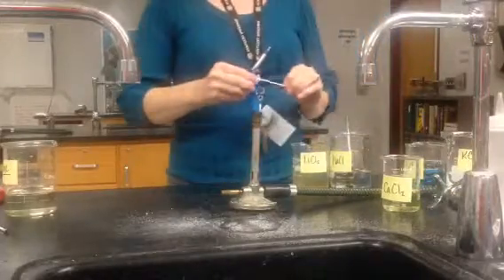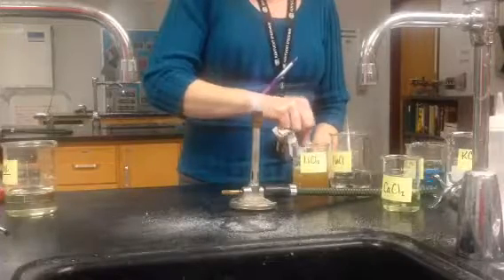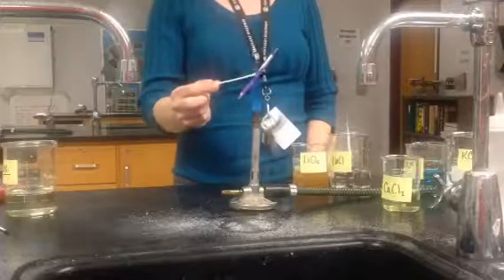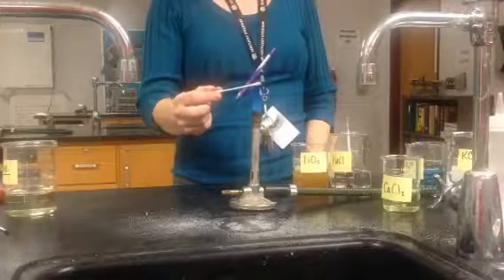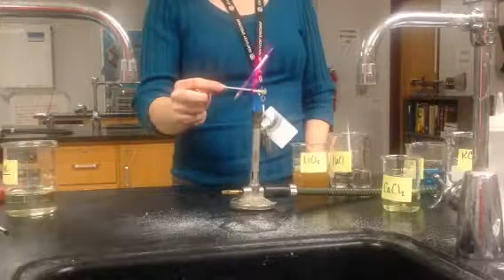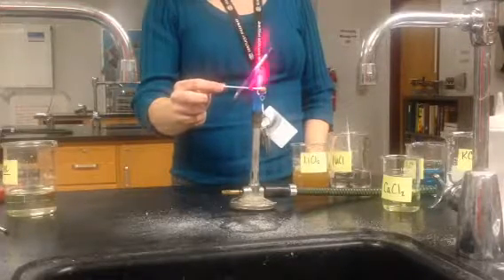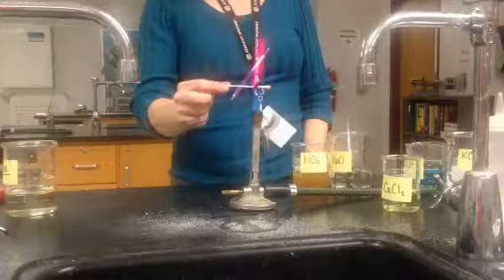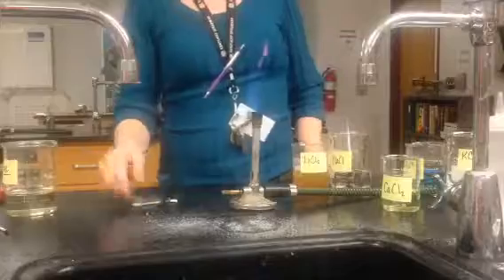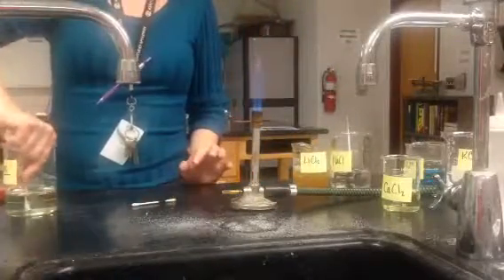Our last potential culprit is lithium chloride. Let's see what it'll do — it takes a minute. It's purple — we've got a magenta from the lithium ion. Now, you might think that looks similar to your unknown, but let's run the unknown one more time. Keep that hot pink you just saw in mind.